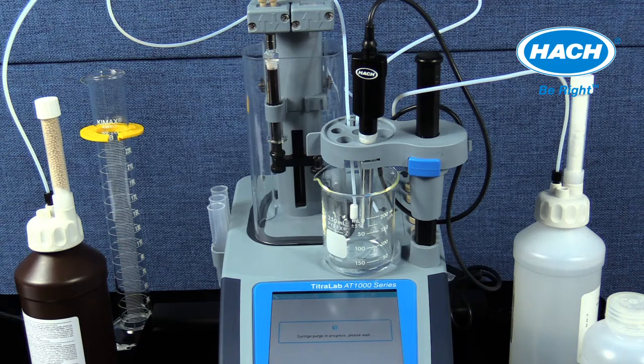Shown in this training is the purging of the reagent connected to the pump. Purging the pump tubing is performed the same way as the syringe by locating the purge icon on the home screen and selecting the correct pump position. When the pump purge is selected, the titrator will cause the pump to activate and a small volume of fresh reagent can be seen to dispense from the pump tubing tip. After purge selection is complete, select OK, then exit out of the purge menu and return to the home screen.